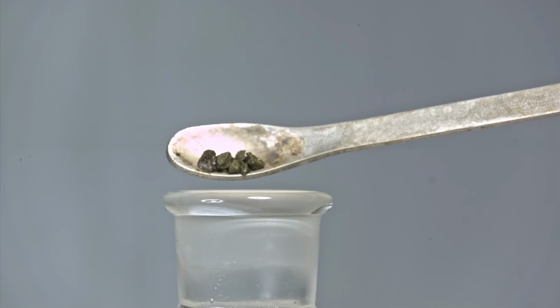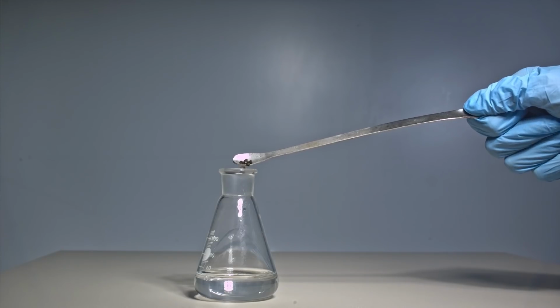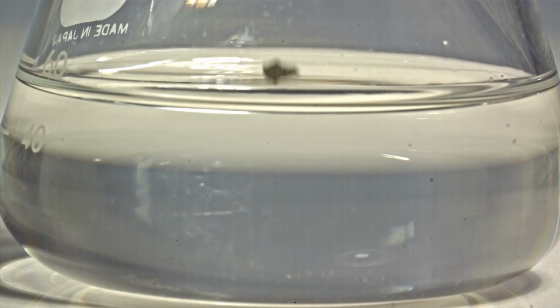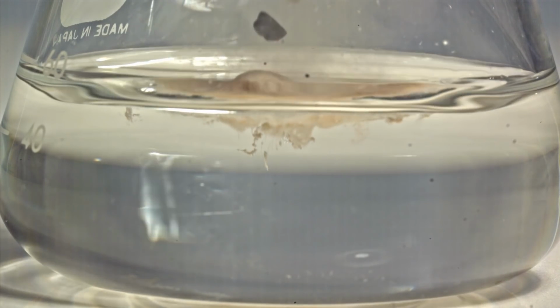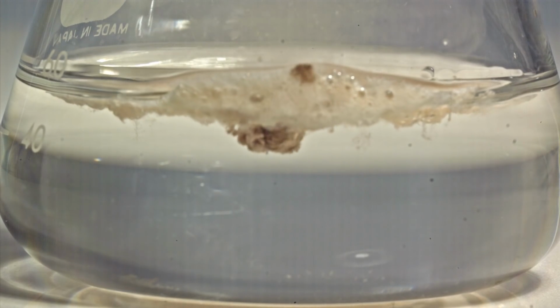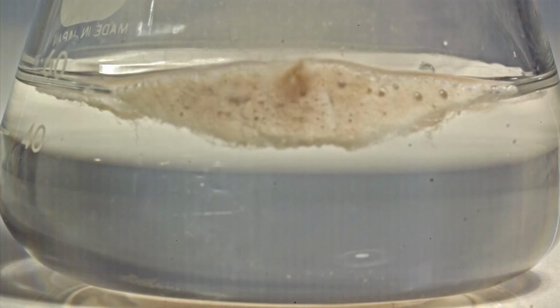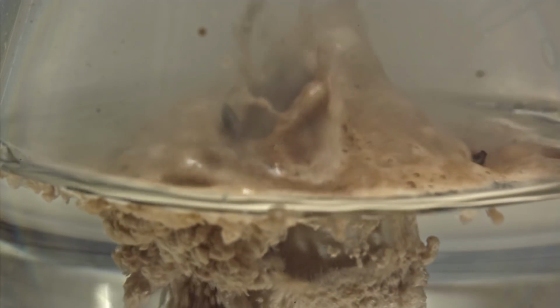Slow motion really helps to understand the principles and the mechanisms of reactions. Notice how a gas bubble forms around the potassium permanganate crystal when it gets into hydrogen peroxide, and when the crystal bounces off of the hydrogen peroxide surface, reaction stops. Such behavior is typical of catalytic decomposition reactions, when the reaction runs only over a catalyst.